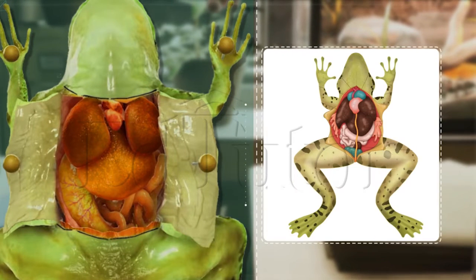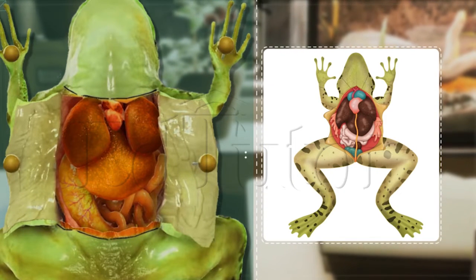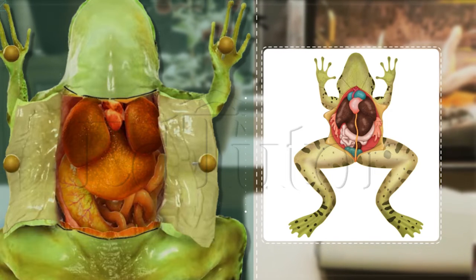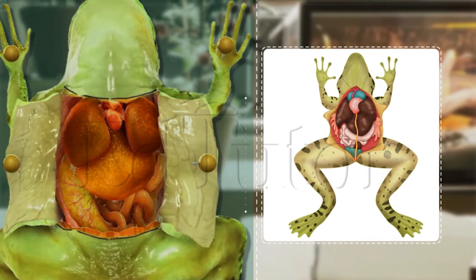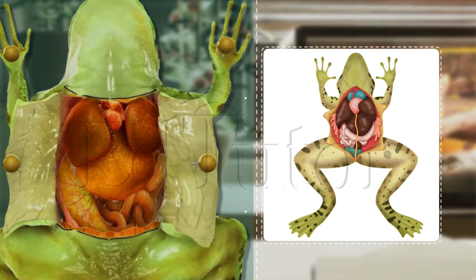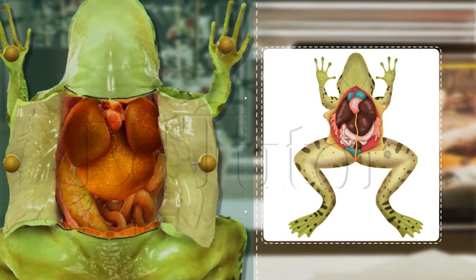I am also attaching a diagram right here so you can see and identify in this practical, or on this image, and try to correlate the different parts of a frog.